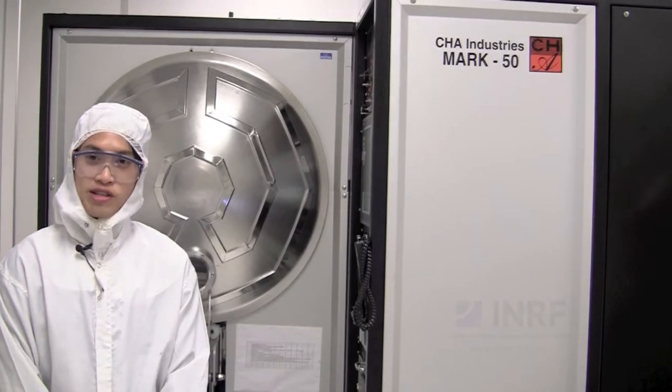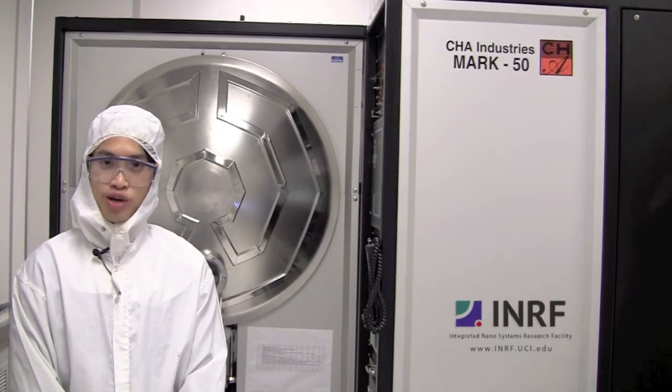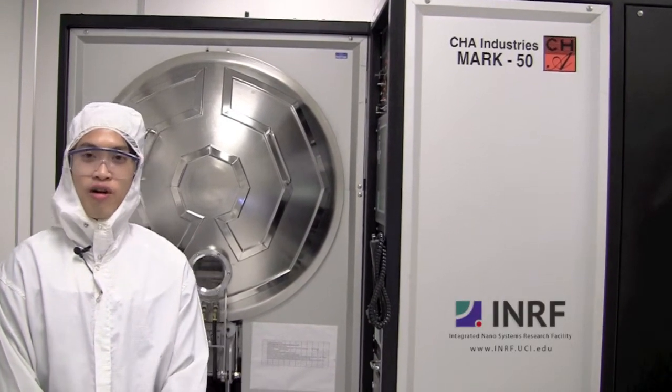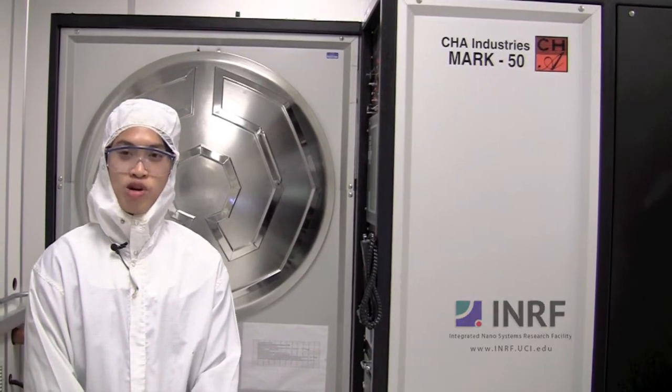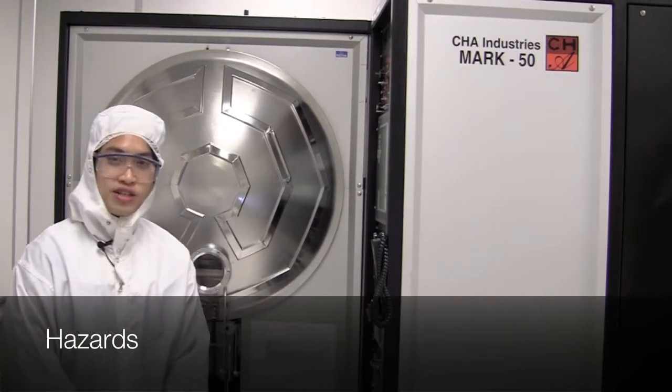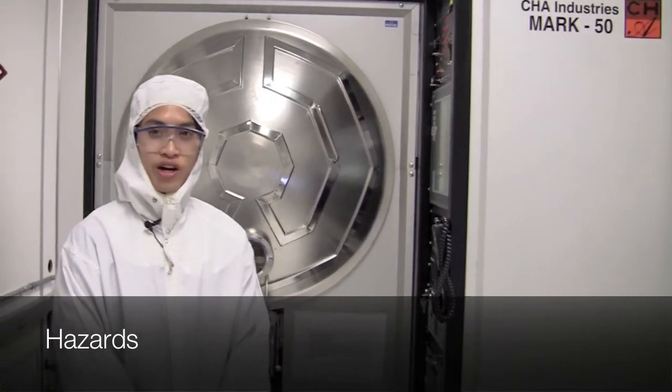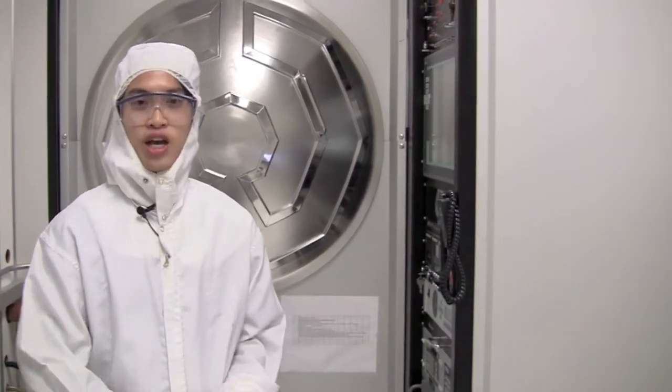Today I'm going to be talking about how to safely operate the CHA Mark 50. The Mark 50 is an evaporator capable of electron beam and thermal evaporation of metals. The main hazards associated with the evaporator are high voltage and high temperature.